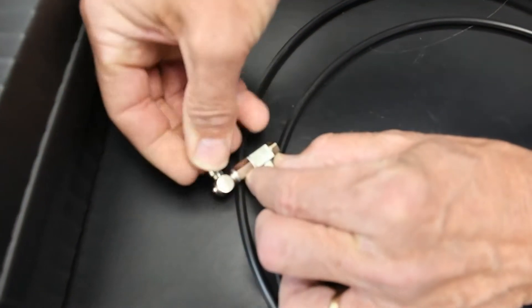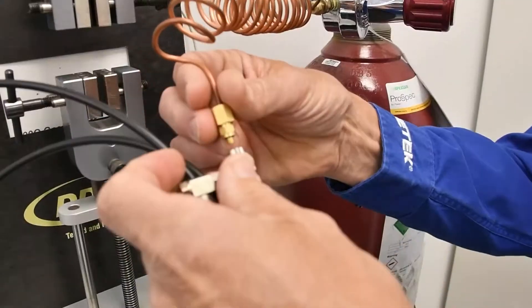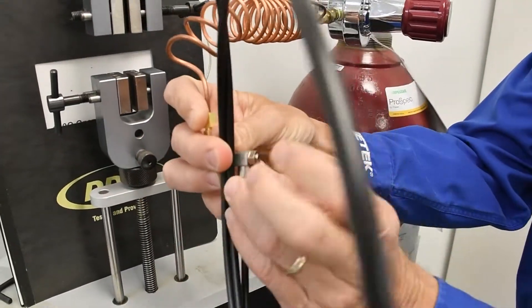Remove the plastic fitting from the pressure relief kit. Install the pressure relief kit onto the nut, ferrule and copper tubing.